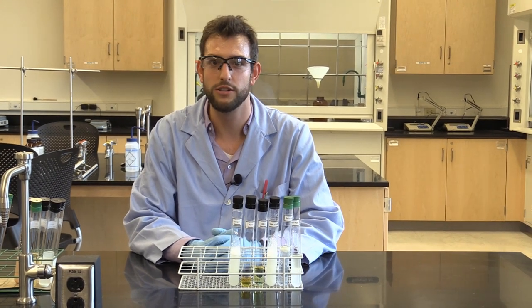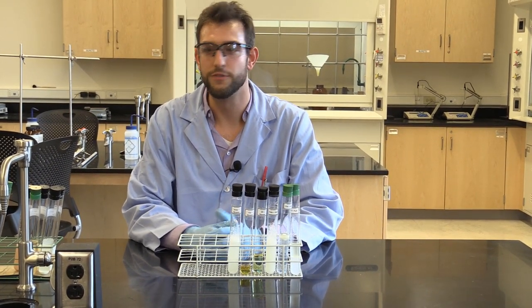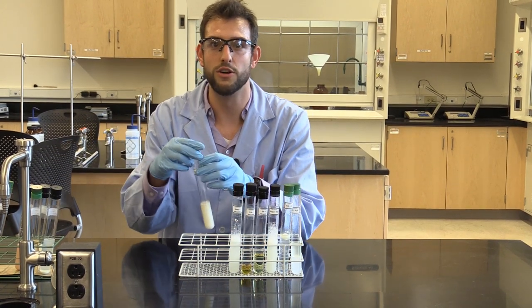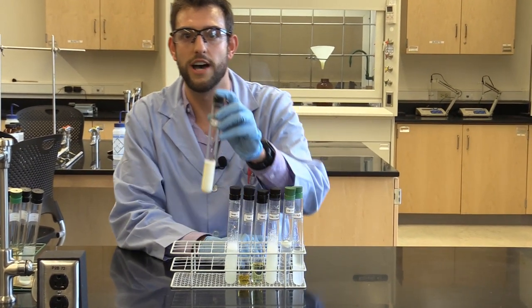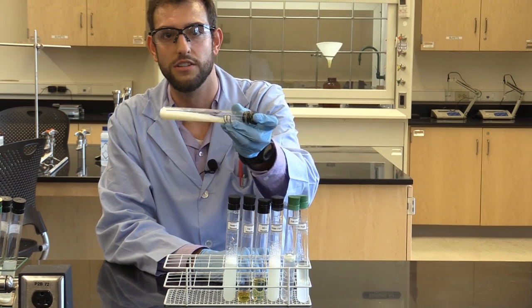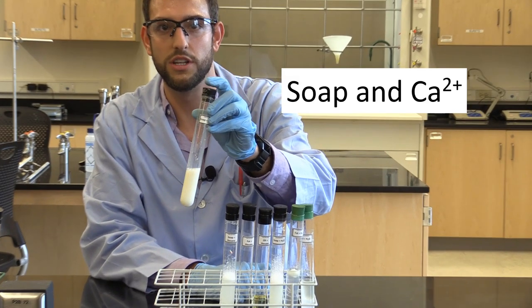Ever wonder why we get soap scum in our bathrooms? I know I do. Well, the answer is solubility. In the first test tube, we see soap mixed with calcium ions. And you can see how it forms a milky white mixture.